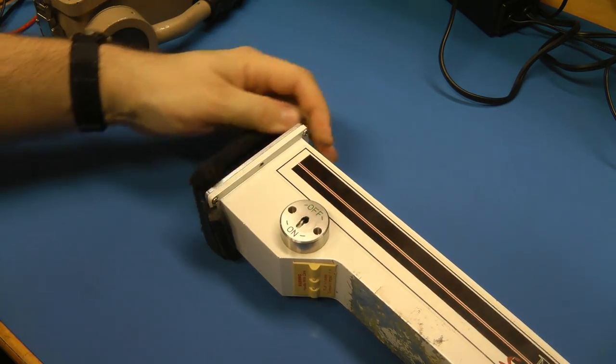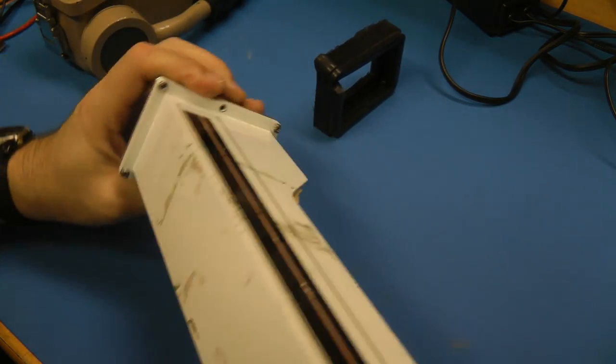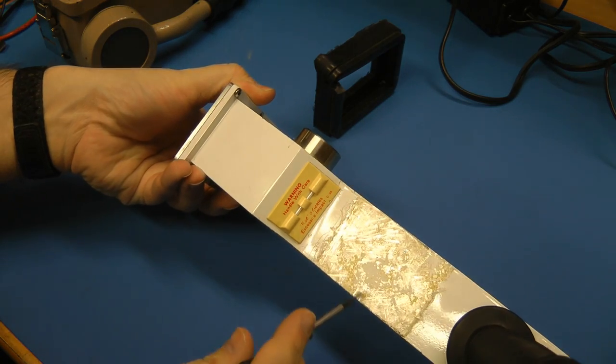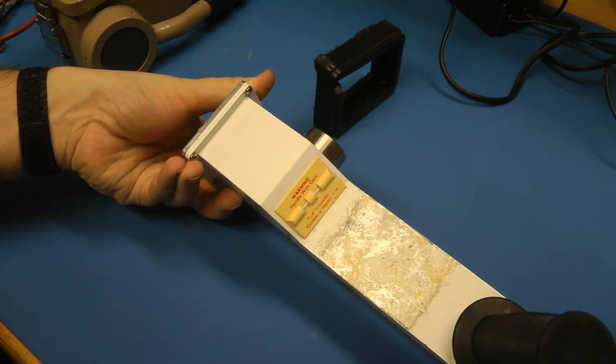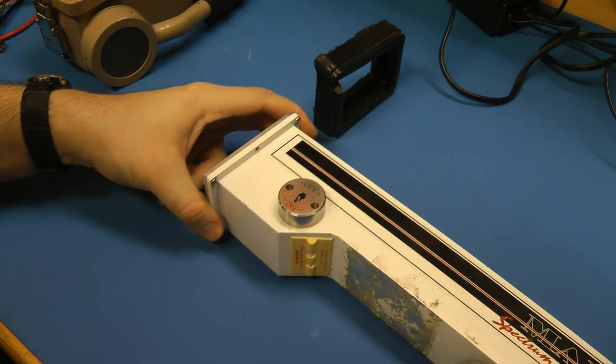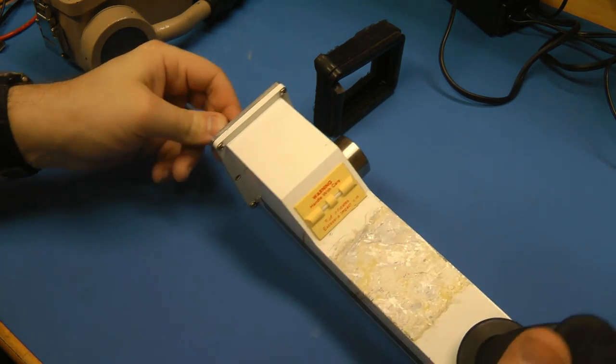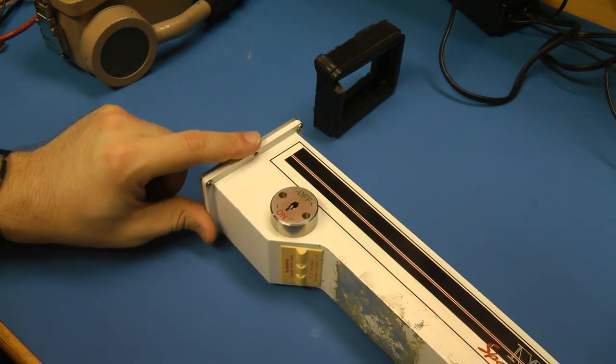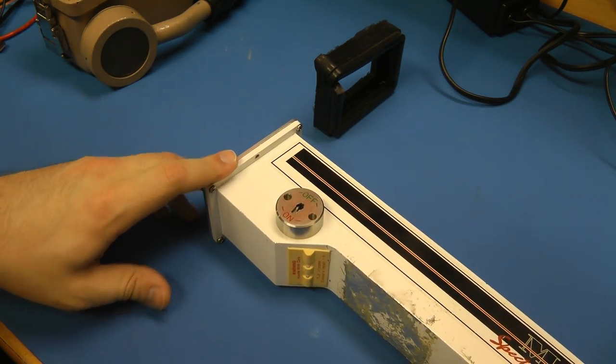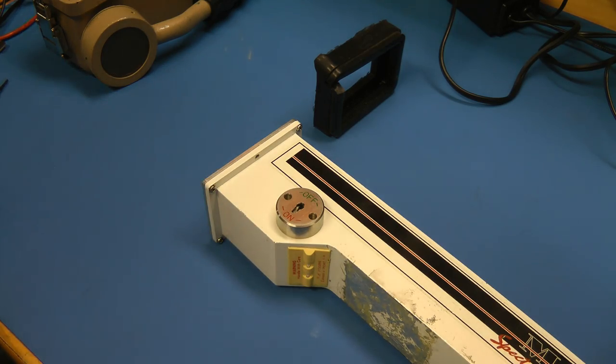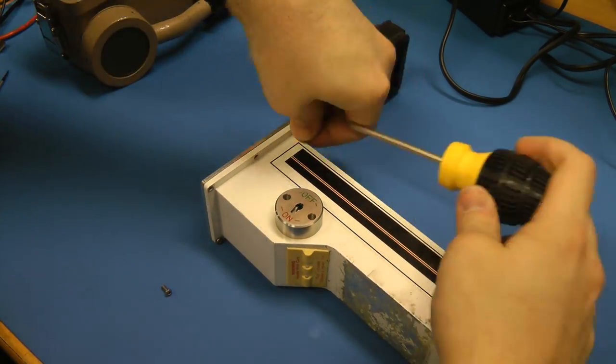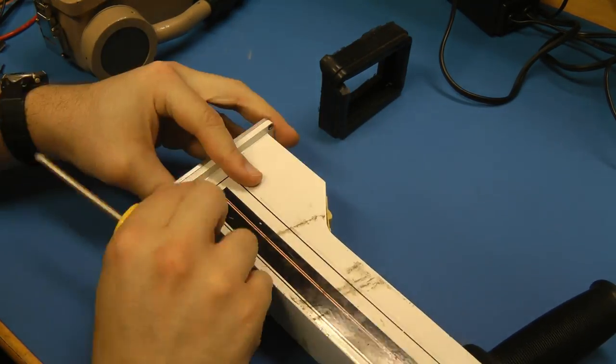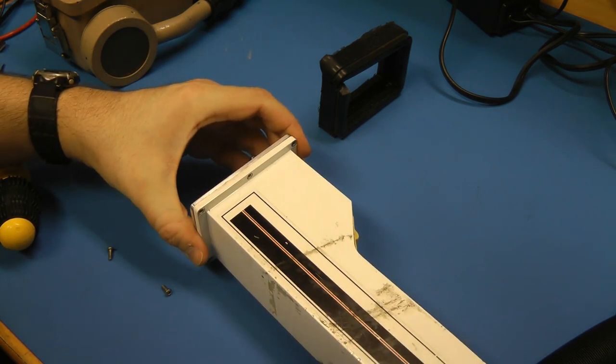So I'm suspecting the source is either completely dead or has been removed. There's some screws missing, so I suspect whoever has been in here may have removed it. Also, there's a label that had been removed here that was probably some sort of radiation warning label. This came from some sort of e-waste facility, so I'm suspecting they may have safed this before disposing of it.